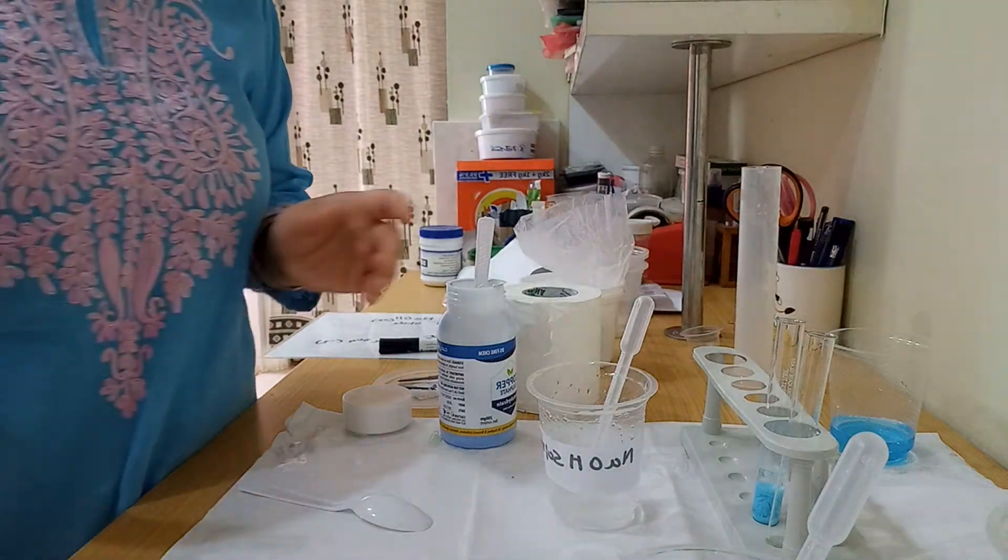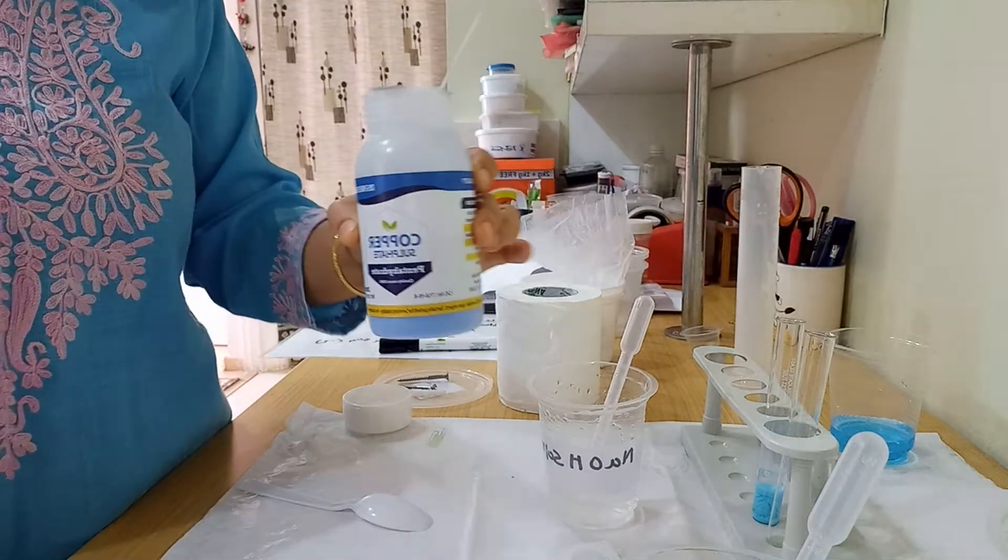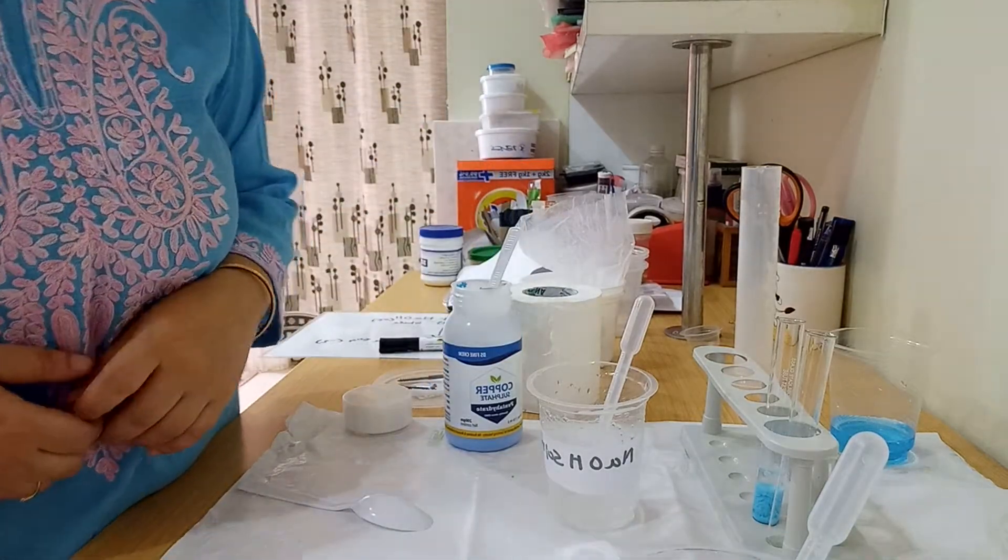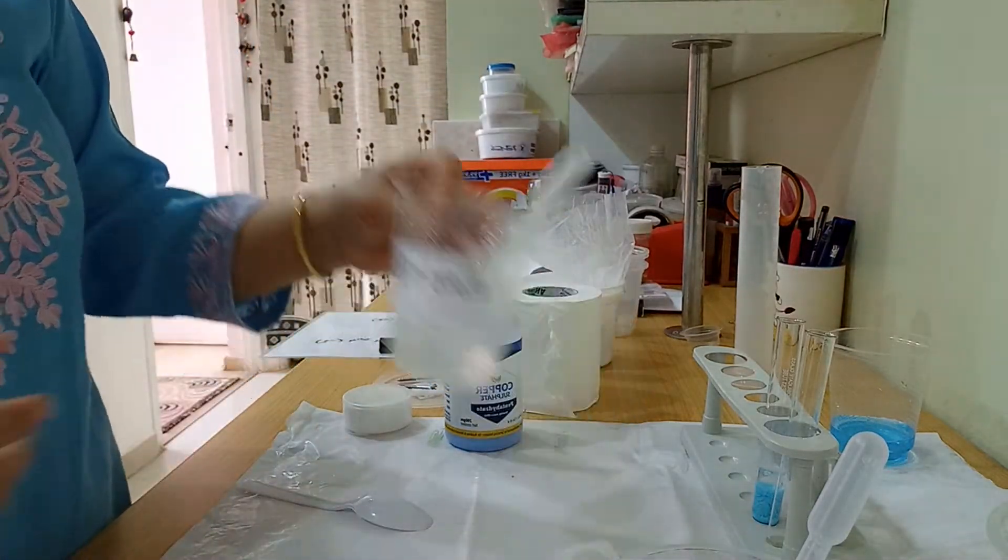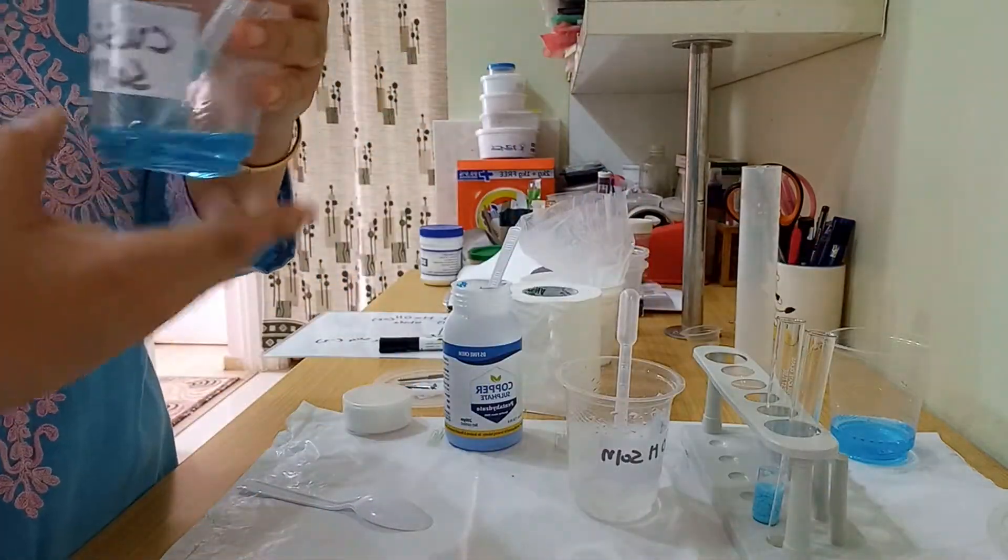Hi students, today I'm going to show you an experiment using copper sulfate and sodium hydroxide. I have already prepared the sodium hydroxide solution here. You can see the copper sulfate solution is also ready.